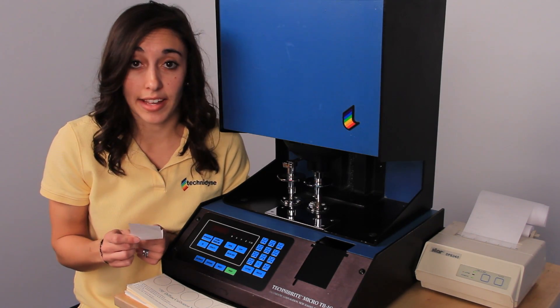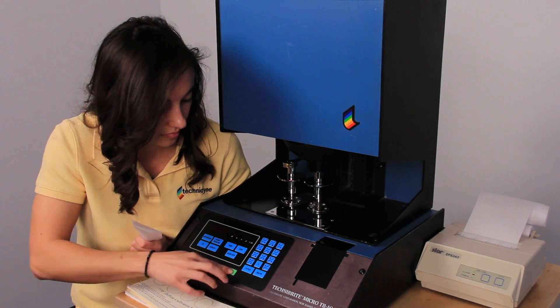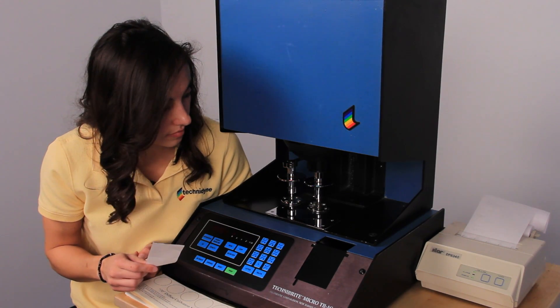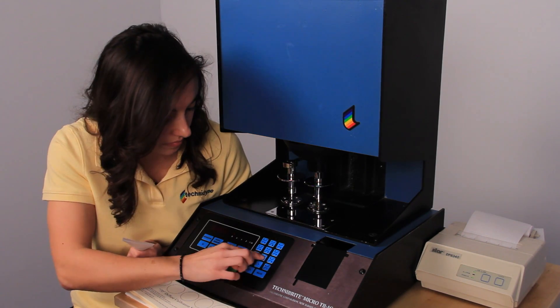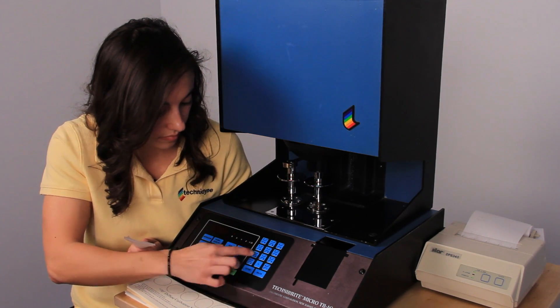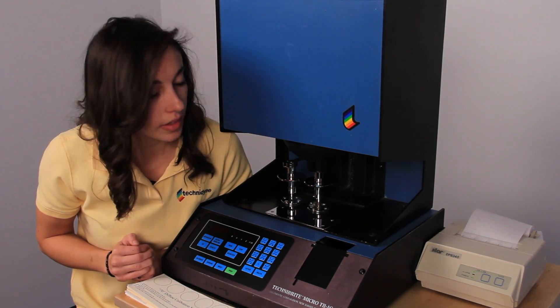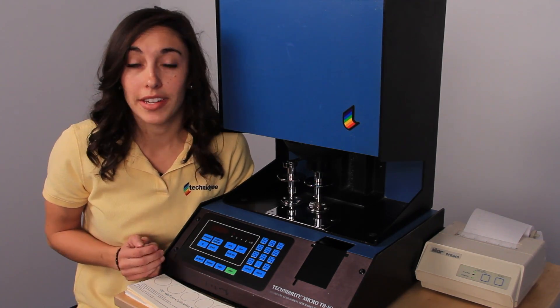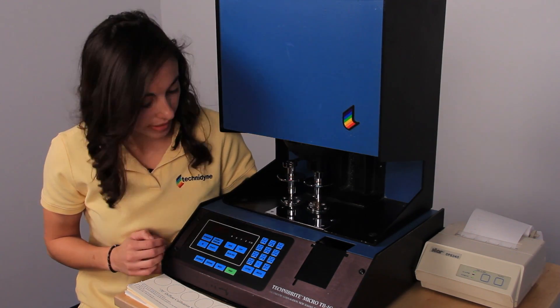Ry, which is 87.10, and Rz, 73.63. If your instrument is like ours and it's equipped with the ERIC option, you can go ahead and input that calibration data now and press print.